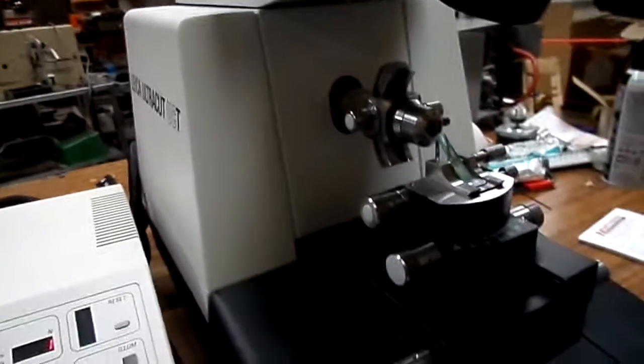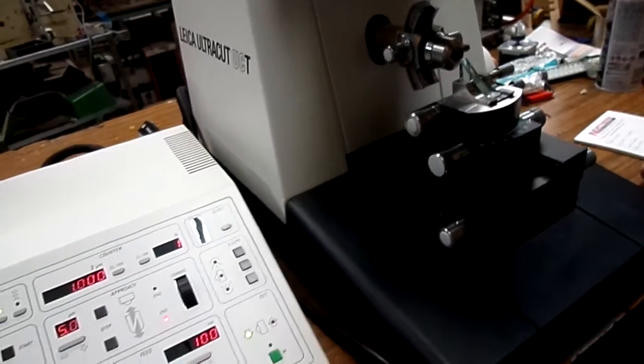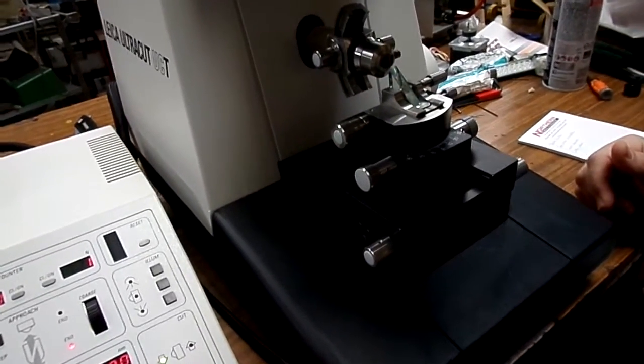So that's it for your controls, how to use it. And that's the end.